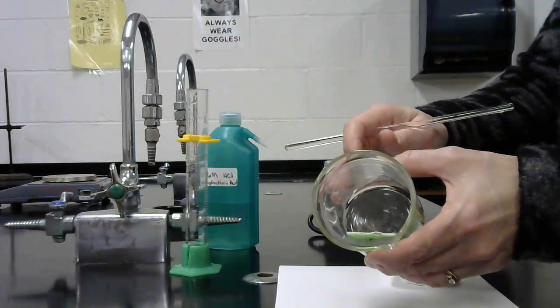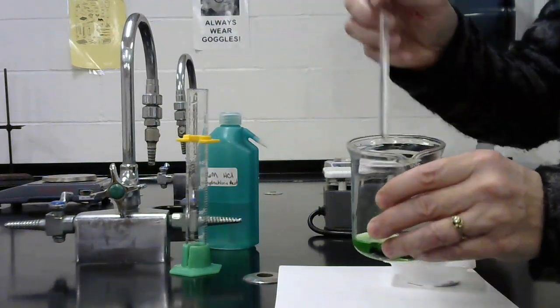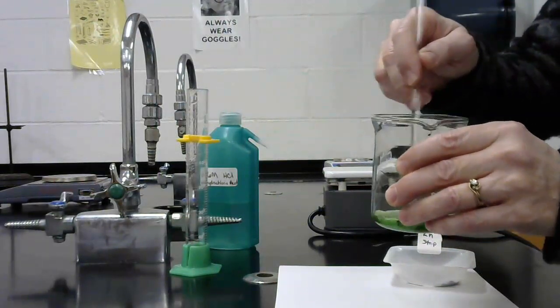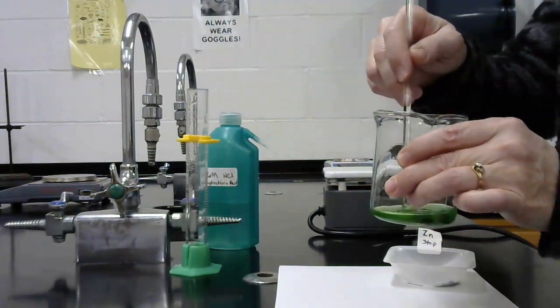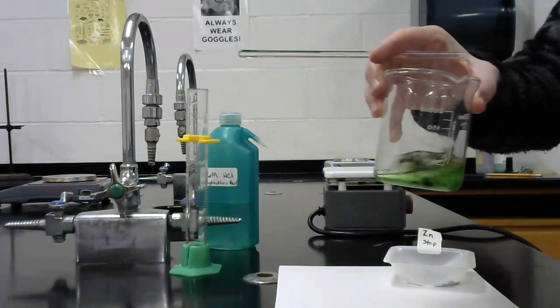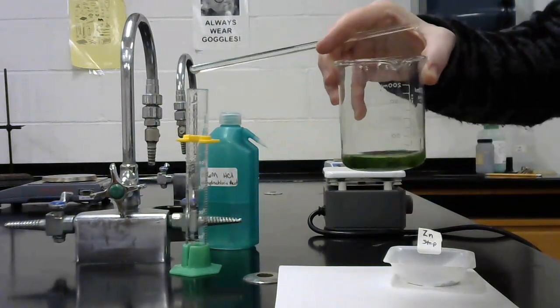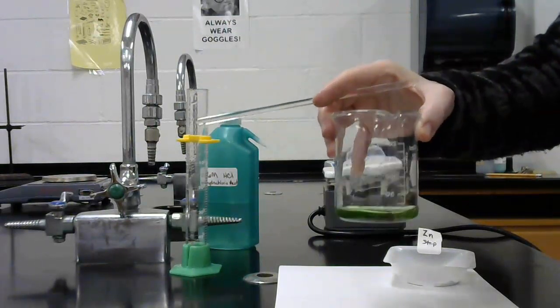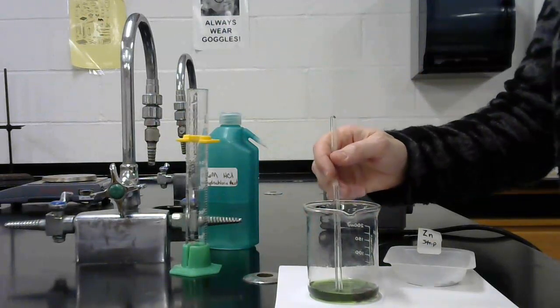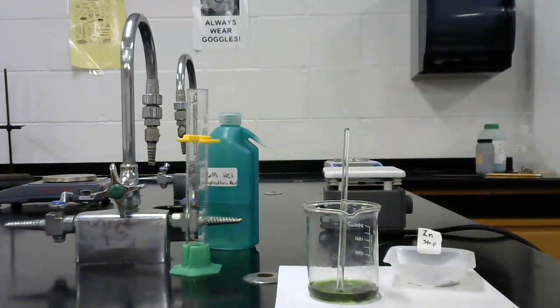So we're going to let this react for a while. I'm going to continue stirring it so that the reaction takes place. And it looks like the zinc is being eaten up, but something else is precipitating. So I want to get this solution to be clear. So we'll let this reaction sit. It does not need to be heated, so it just needs to sit, and I will stir it for a while until it is done reacting.